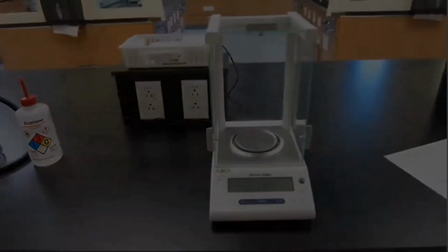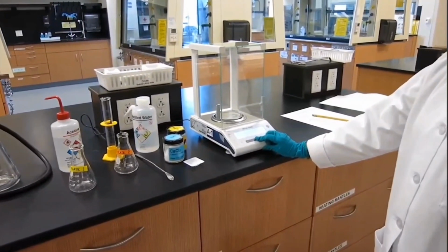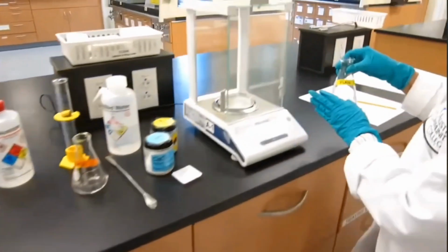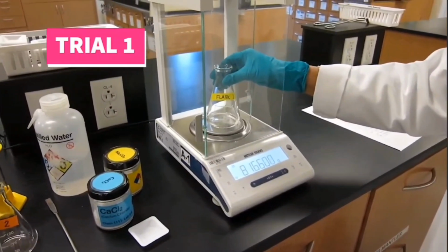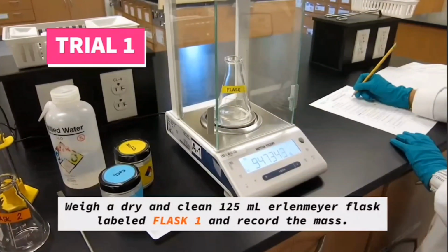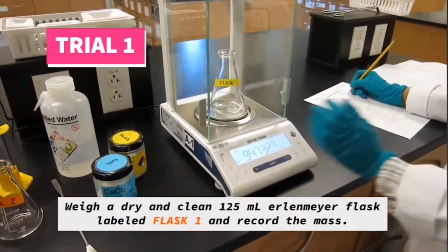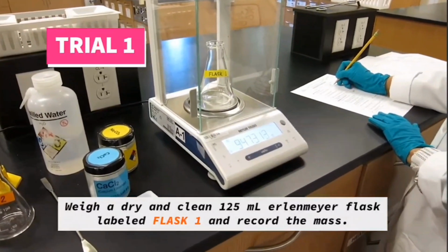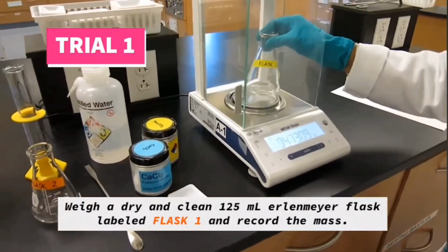And then the first thing is you are going to take your flask 1 and zero the balance. Tare the balance first, and then you're going to weigh your first Erlenmeyer flask and record the mass, and make sure to write down all the significant figures that the balance gives you.